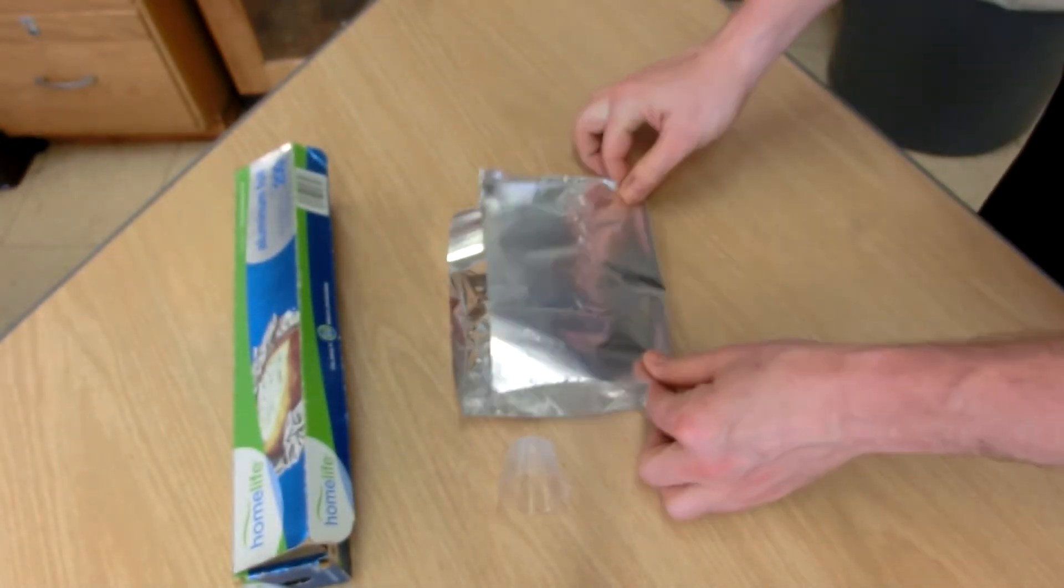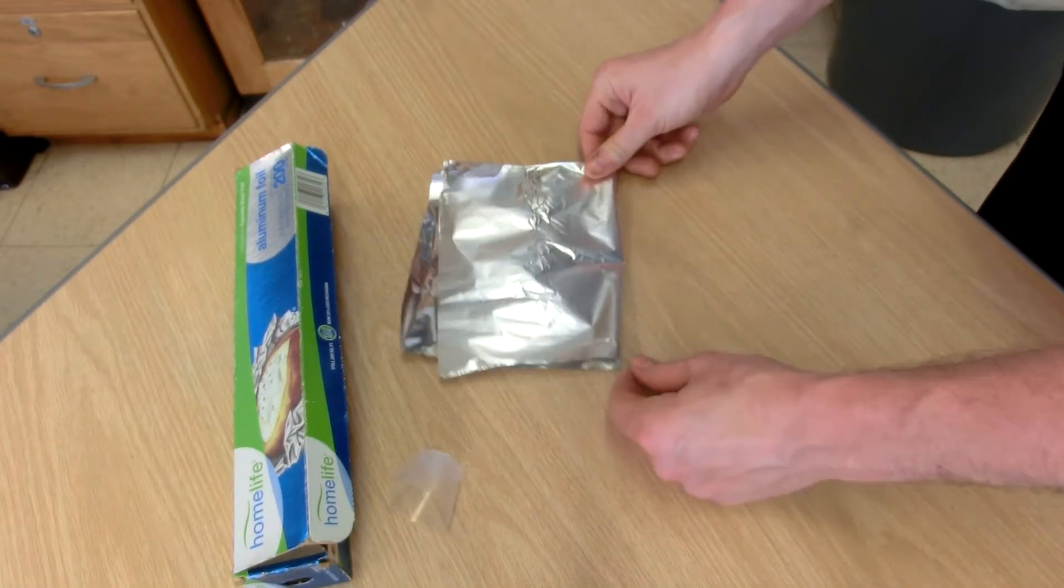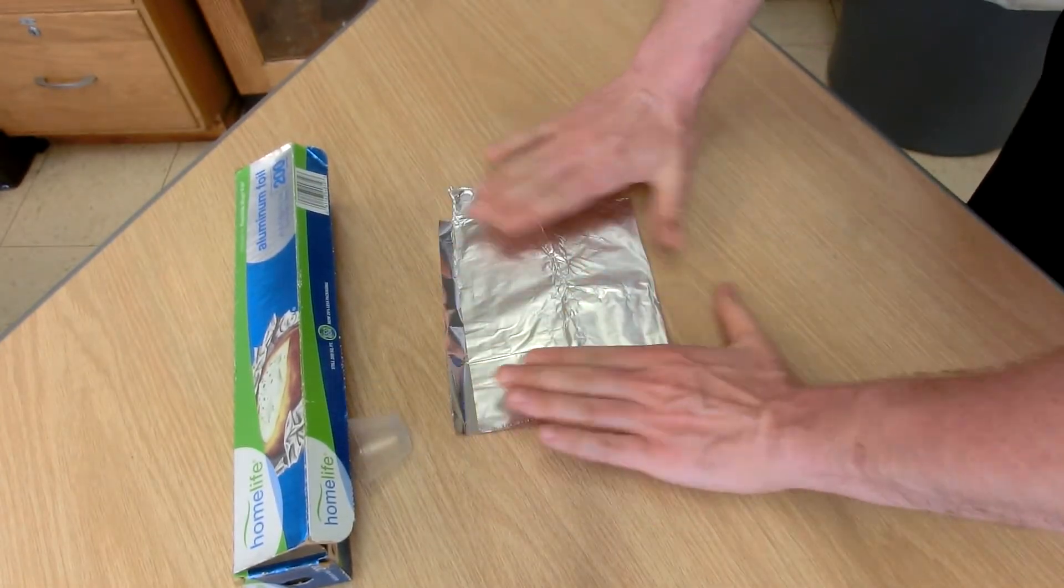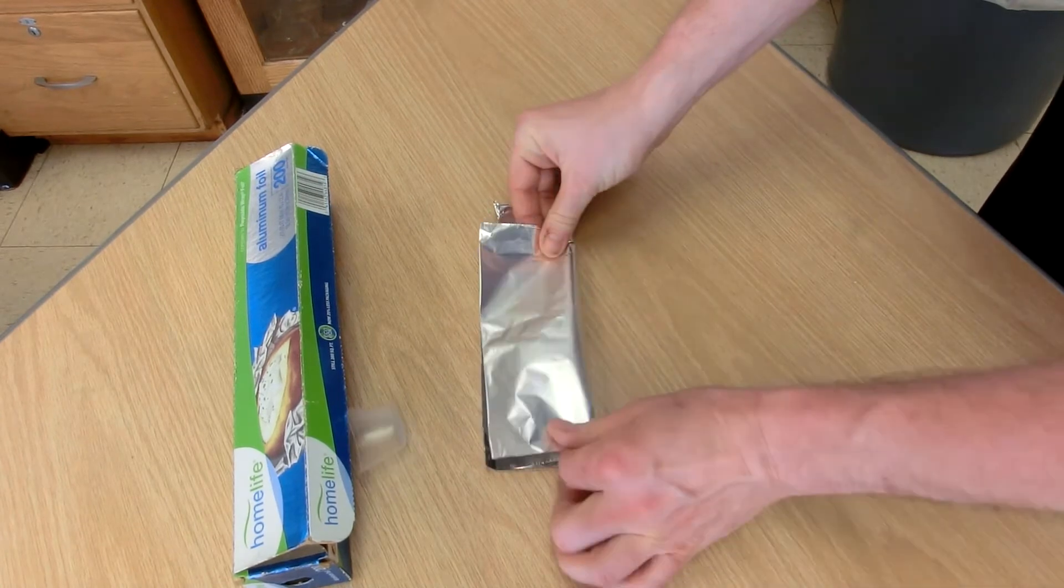I took about a 10 centimeter long piece from a standard aluminum foil package and folded that piece in half twice.